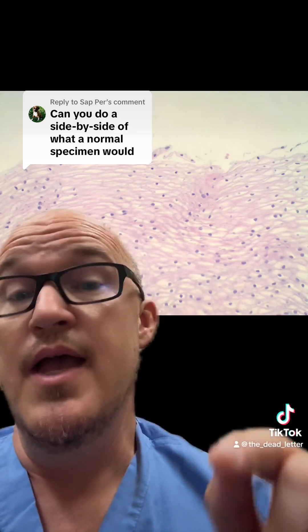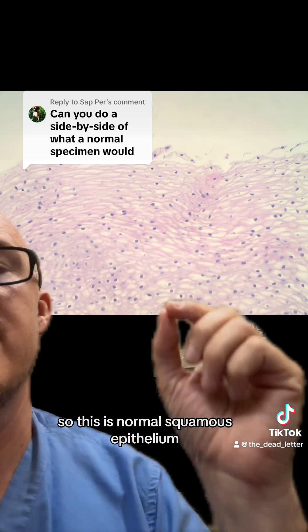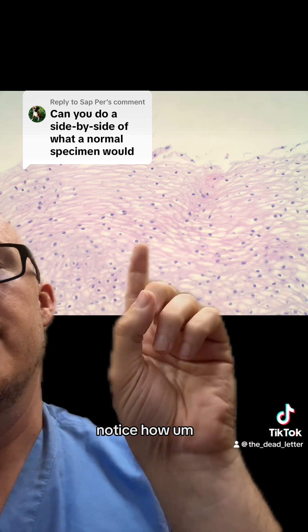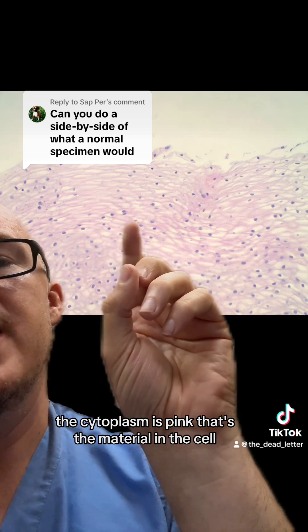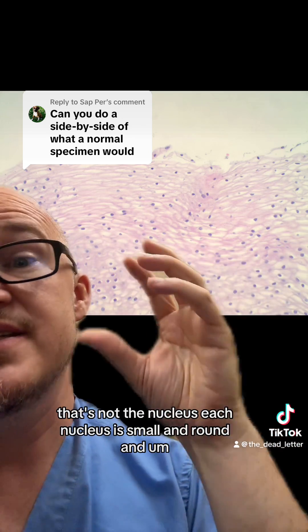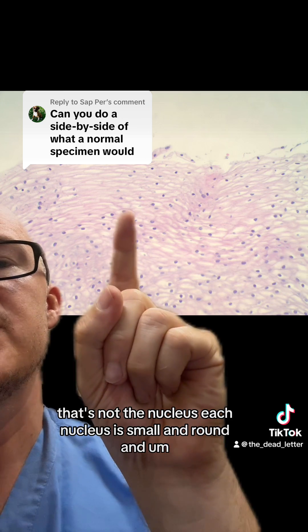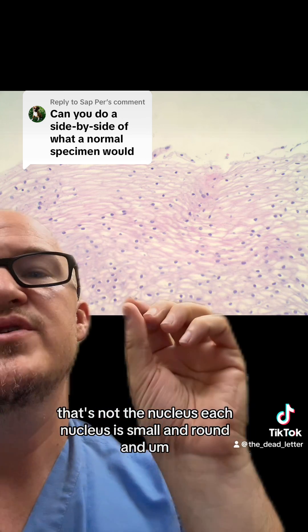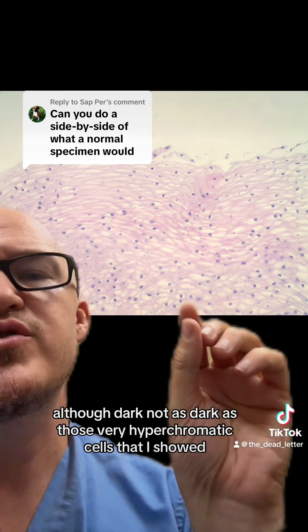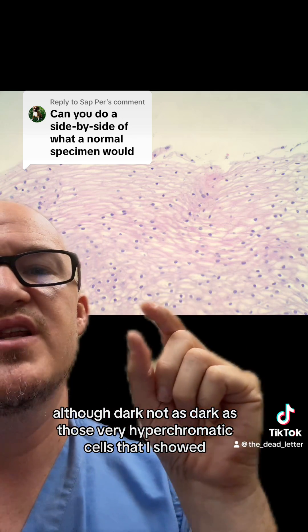Now let's see a normal. This is a normal cervix — normal squamous epithelium. Notice how the cytoplasm is pink; that's the material in the cell that's not the nucleus. Each nucleus is small and round, and although dark, not as dark as those very hyperchromatic cells that I showed.